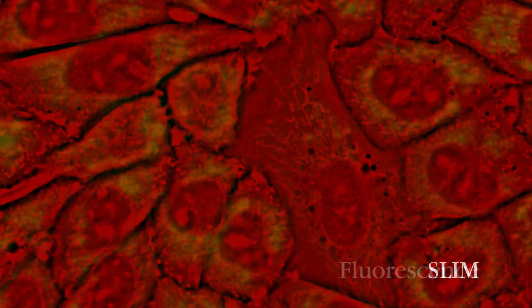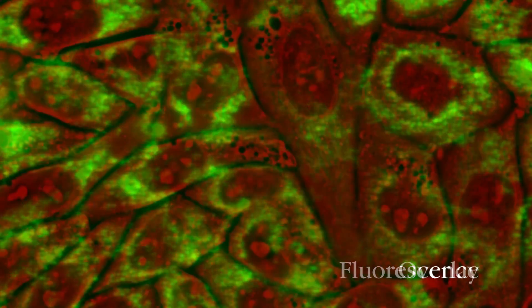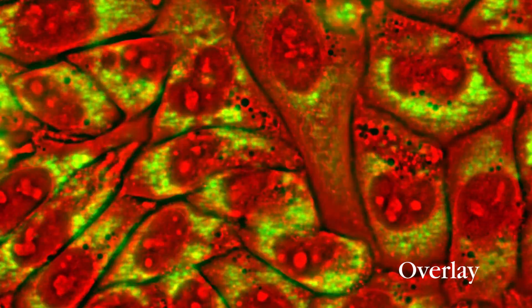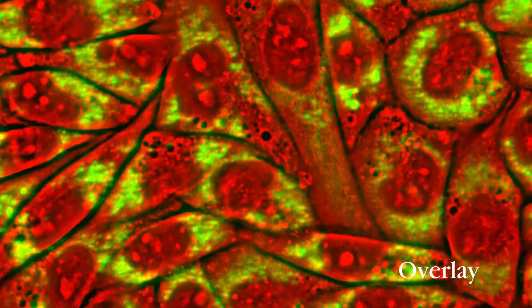We know fluorescence imaging is still important in many experiments, and that is why SLIM was designed to overlay easily with the fluorescence channels.